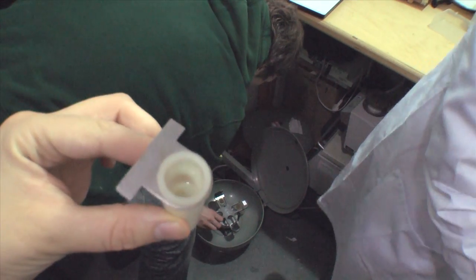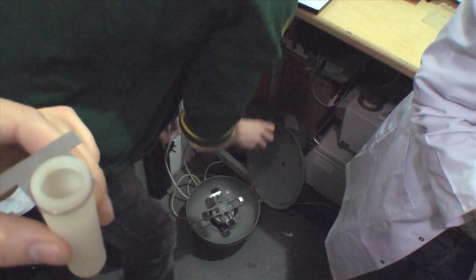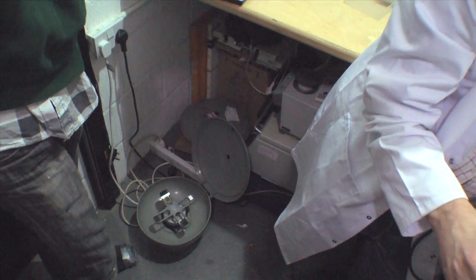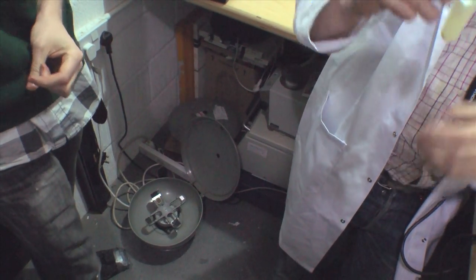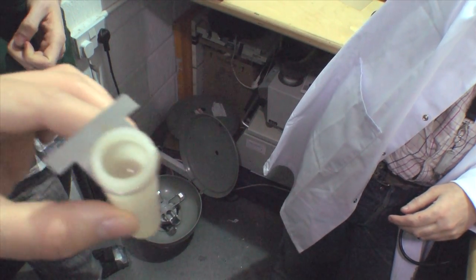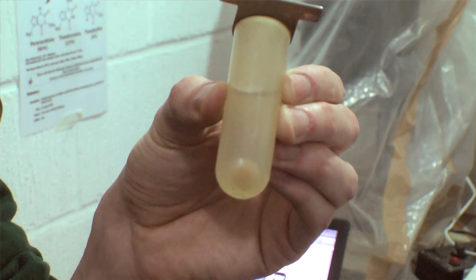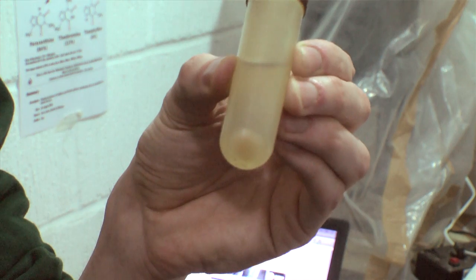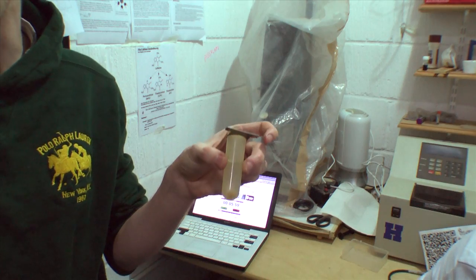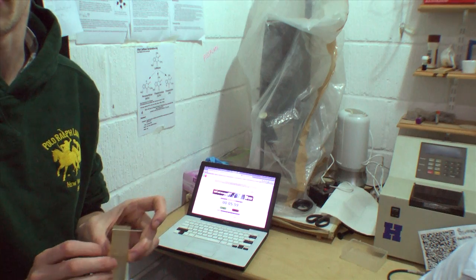It's Louie's. Have a look if you've got a pellet. I've got a pellet. Simon, I don't think you'll be able to see it. You got one? I think I do, yeah. It should look like that. Oh yes, I've got quite a pellet there.